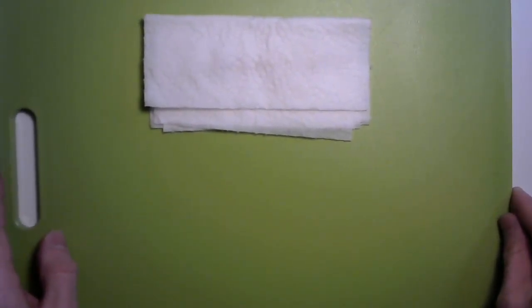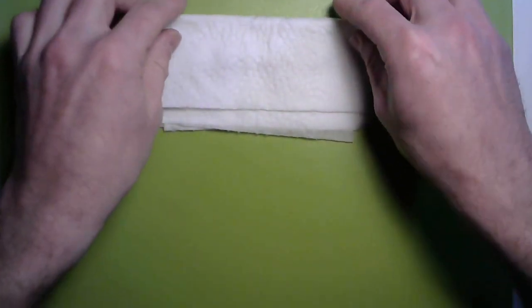Now there's some things you're going to need to be able to do this kind of work. You will need a cutting board and also some pre-soaked seeds. Here's mine right here.